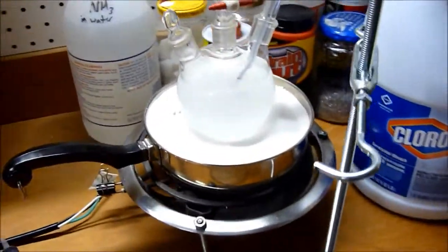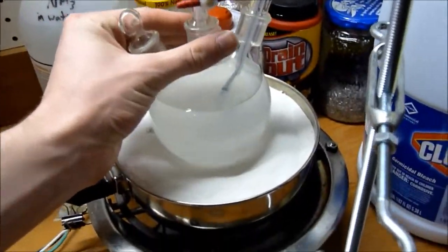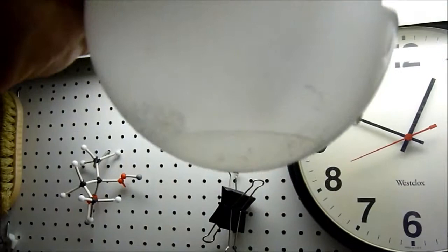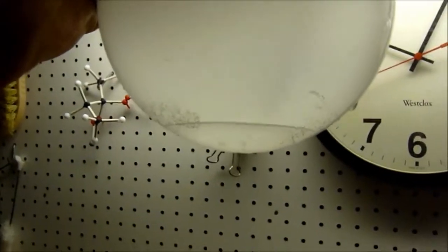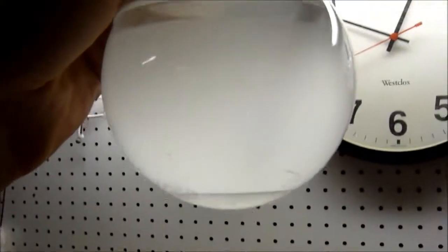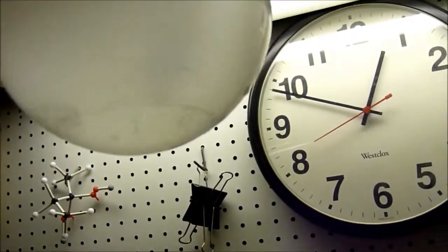As you can see by the absence of the green color, the reaction has gone to just about completion. There's a little bit of sand stuck to the bottom, but you can clearly see the separating phase on the bottom of trichloromethane. The cloudiness is starting to settle.